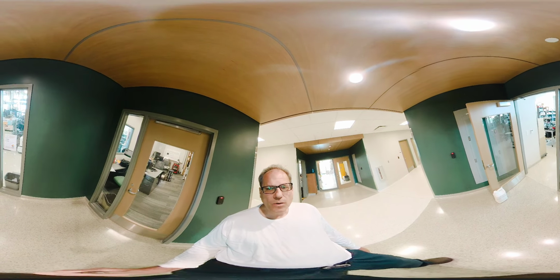So I'm just walking through my lab here, starting one side, one end of it. What you can see here on the left is one of the vacuum chambers. We run our experiments at very low pressure for keeping the samples clean, and most of our analytic tools wouldn't really work on air. That's why we pump down these systems in the 10⁻⁹, 10⁻¹⁰ torr range. And perhaps you can see here on the table, that is one of the little gizmos we use. That is a source that generates atomic hydrogen, which we use mostly for cleaning purposes of our samples.